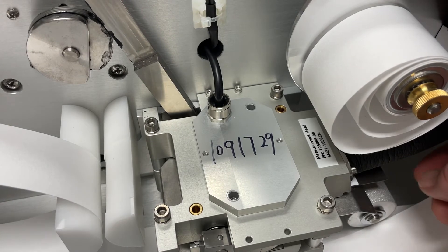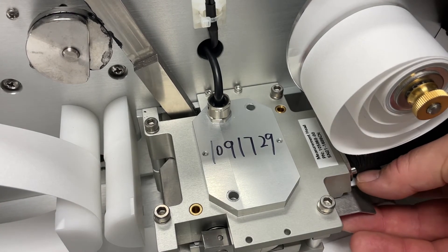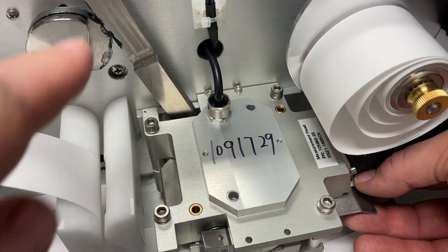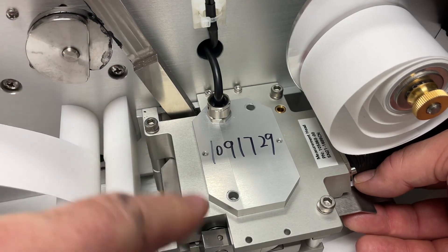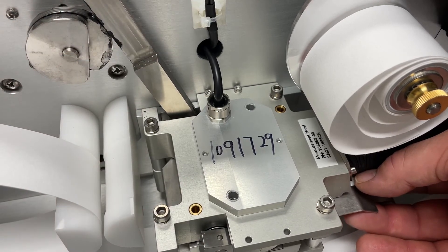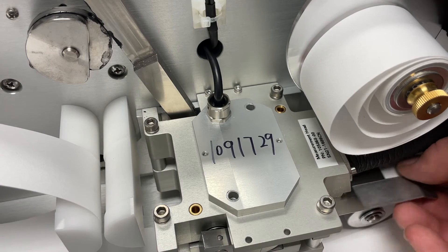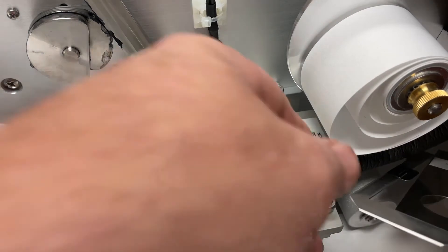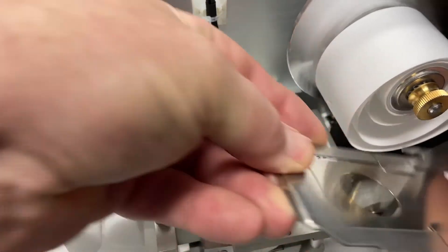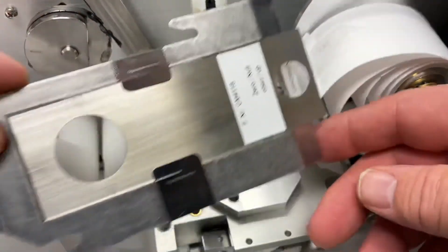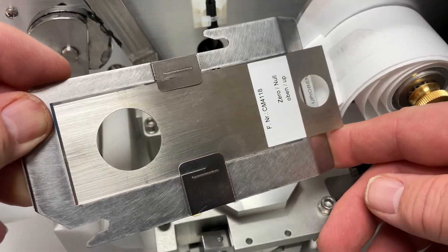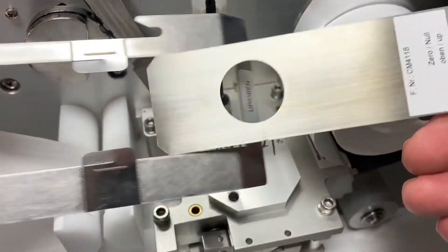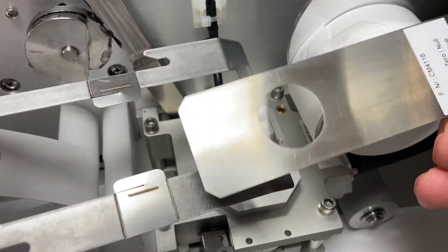When the calibration is completed, you'll just simply lift the head again. You'll have to activate the head and raise it again, and then you'll remove the foil calibration bracket and bring it out. There it is—there's the foil. You can just simply slide this out and put the next one in.